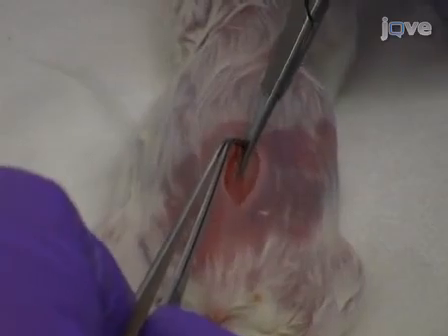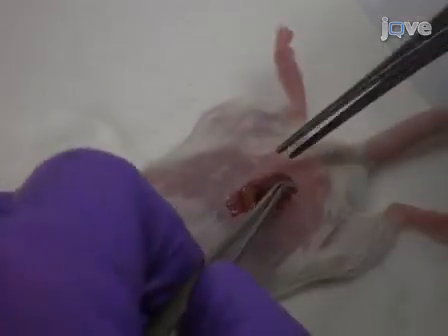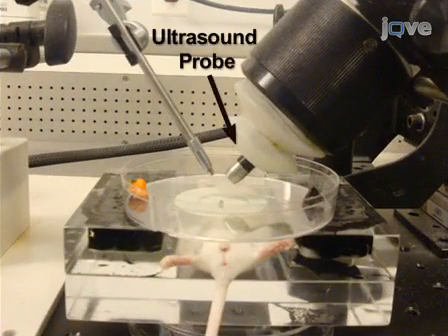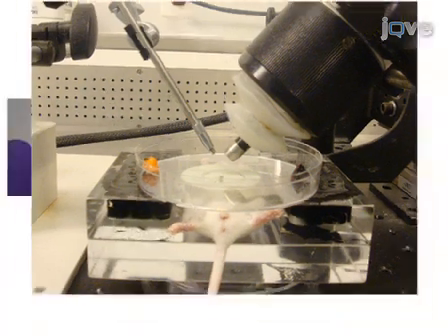This is accomplished by first performing a laparotomy on an anesthetized pregnant mouse, which permits access to the embryos. The second step of the procedure is to place the pregnant mouse on the injection stage under the ultrasound transducer. Then, position the embryos on the plate for injection.